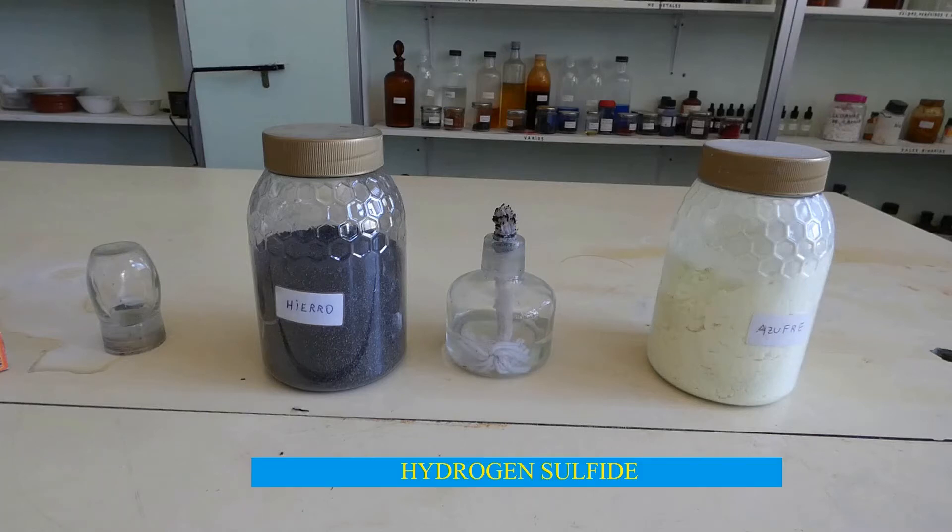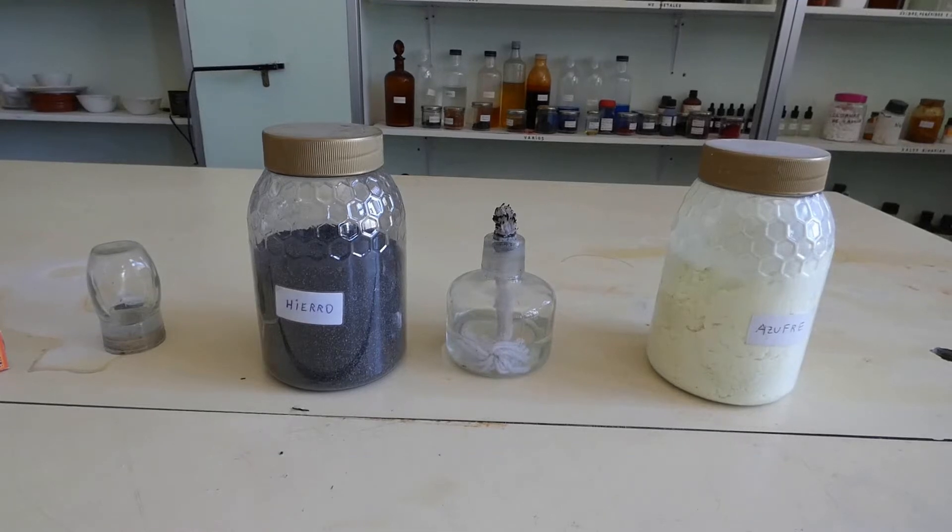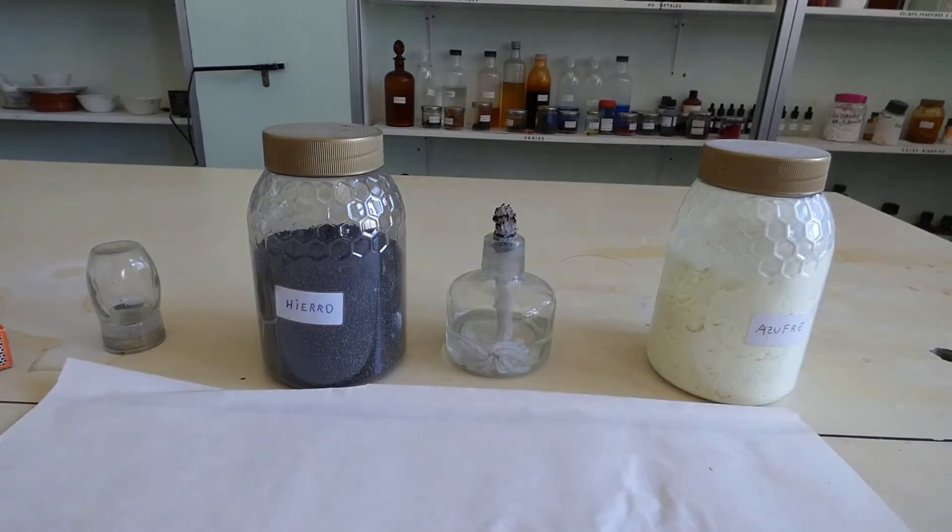Let's make hydrogen sulfide. Hydrogen sulfide is a gas with an unpleasant smell.